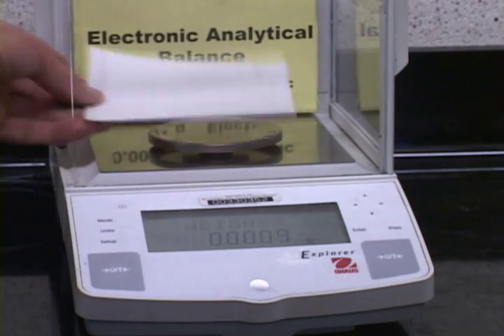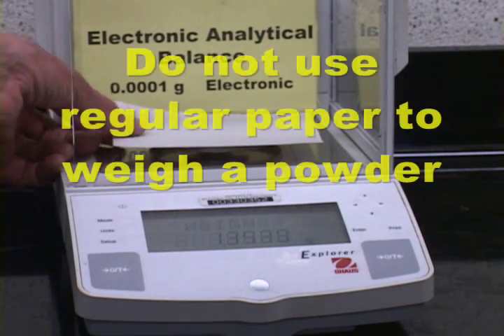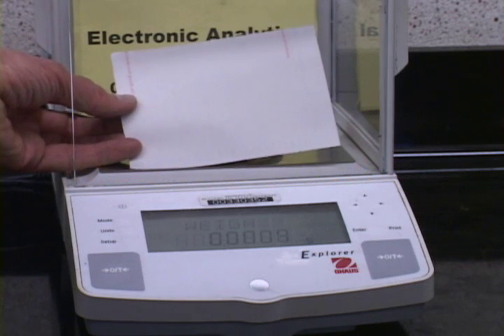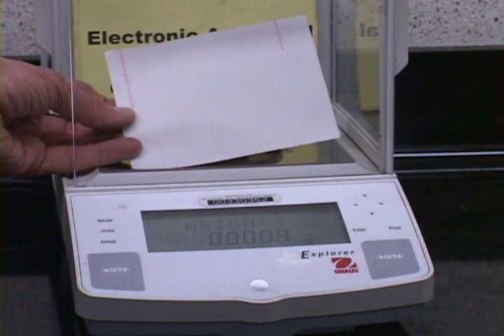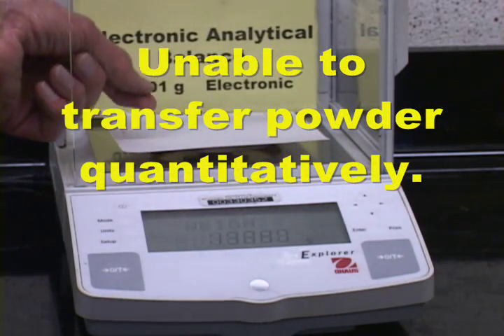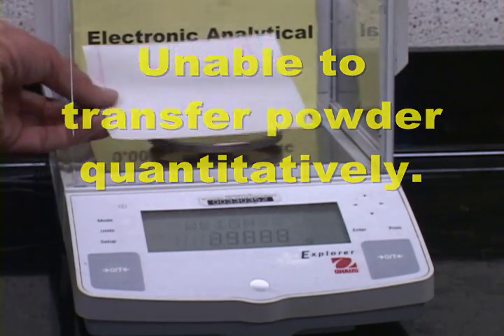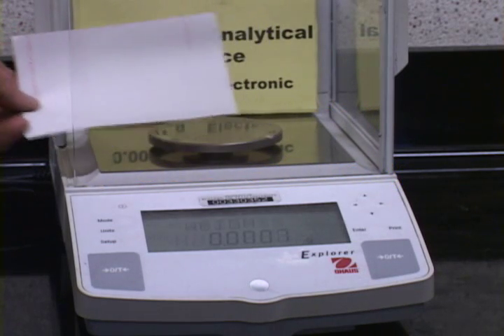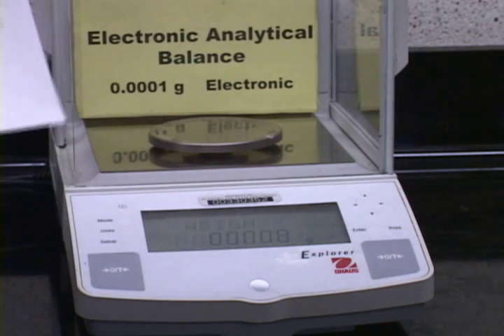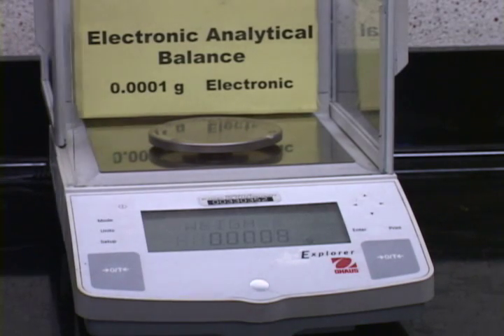Do not use regular paper in weighing out powders on this balance. There is something called weighing paper, which is used for analytical balance. It has a very slick finish. But regular paper is much too porous, so if you weigh out something very accurately here, you probably will be unable to transfer it without losing some due to the porosity of the paper.